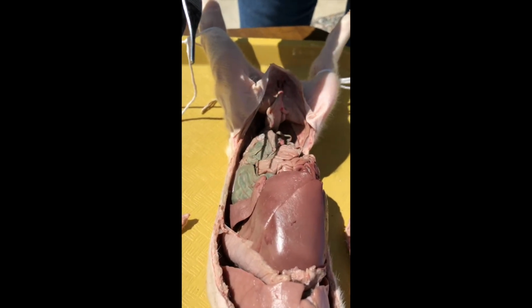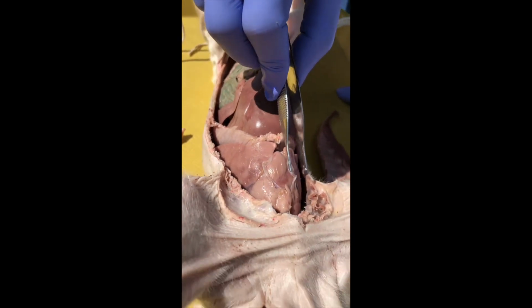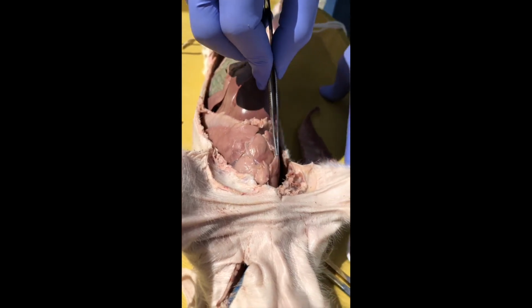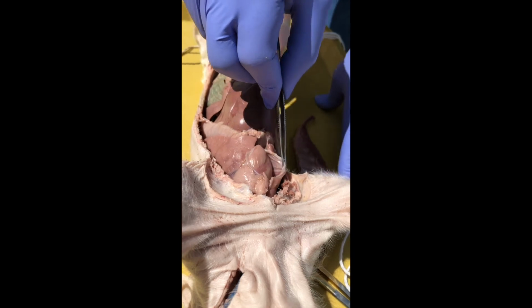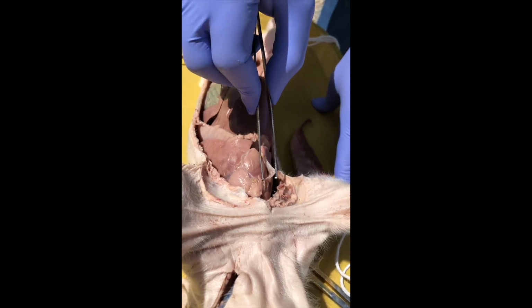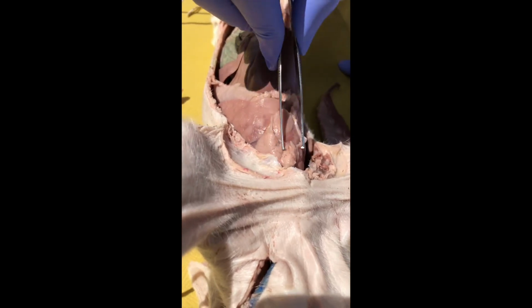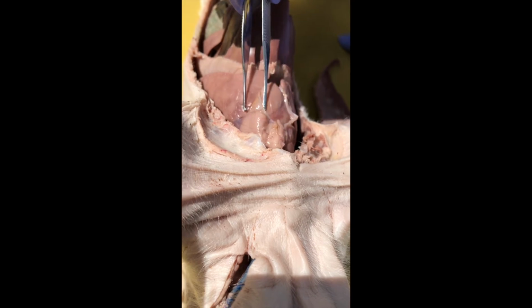Okay, so let's start in the chest. And there we go, now we got our light back. Beautiful. A lot of these membranes are still the serosa, we could say. Here's the heart inside of the pericardial sac. Gorgeous. And look at this thing. You see that kind of thick stuff on it that's embedded in the pericardial sac? That's actually thymus. It's a gland.